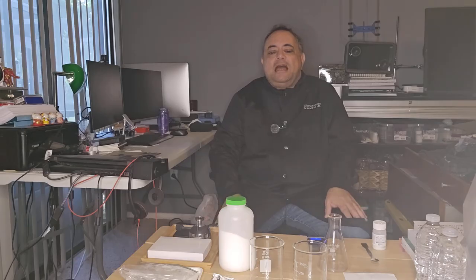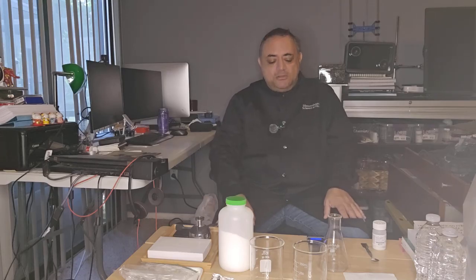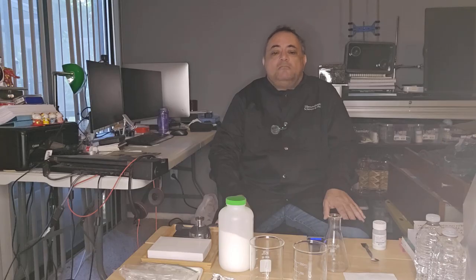So that's why I made the decision to make a video on the chemical traffic light reaction, because it is so important, it is so fundamental, and I thought, let's do it. So what you need for this is indigo carmine.